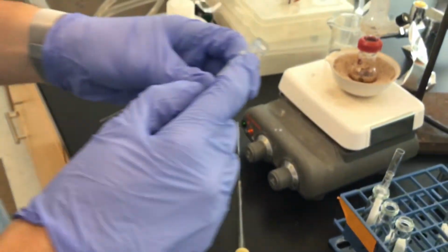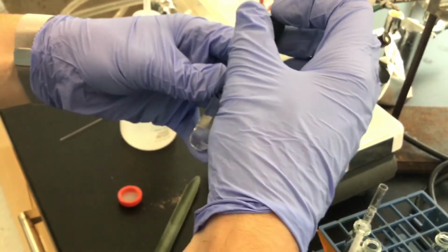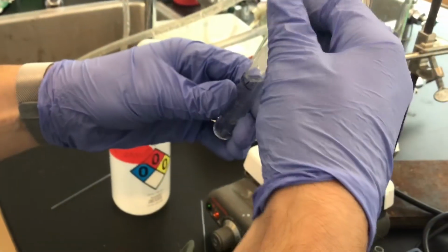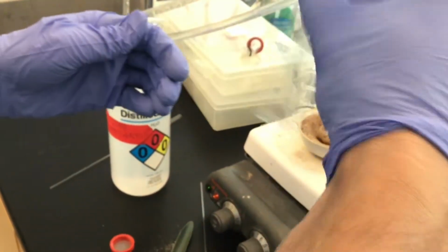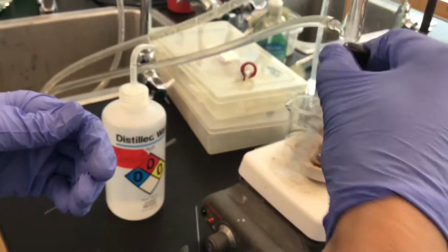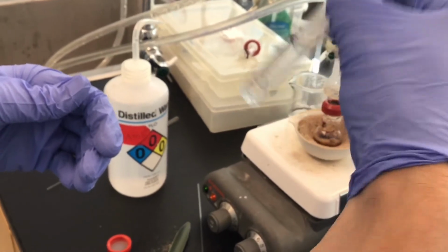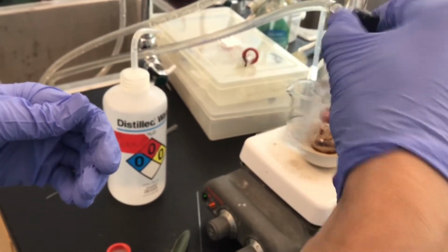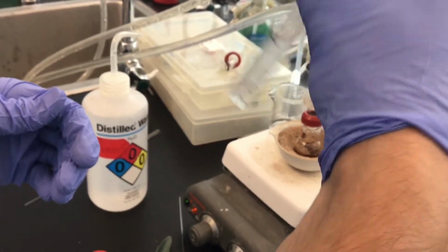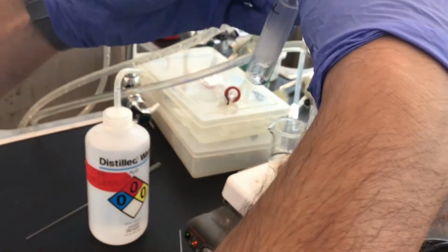Alright, so the culture tube has the thread for a screw cap like this. I don't want to shake it too much because it tends to leak. It's not sort of watertight. So I'm just going to shake it like this, and the methylene chloride is going to meet the aqueous layer, and the more lipophilic trans-Cinnamaldehyde is going to be more soluble in the organic layer, the bottom organic layer.